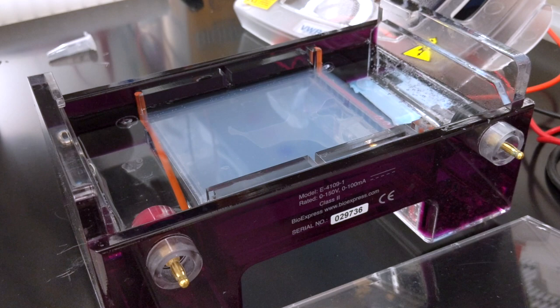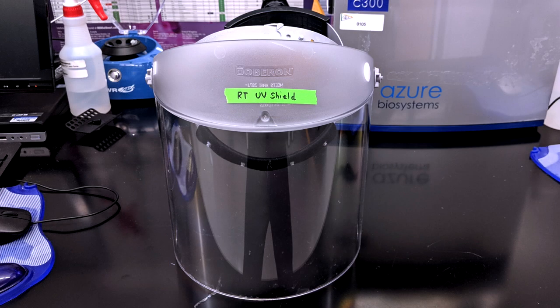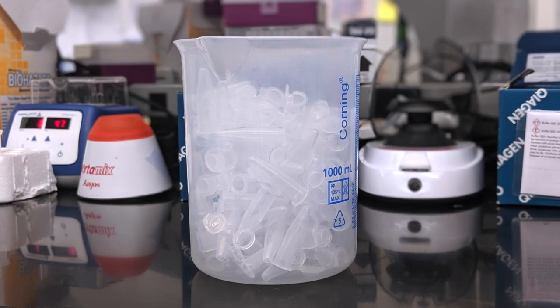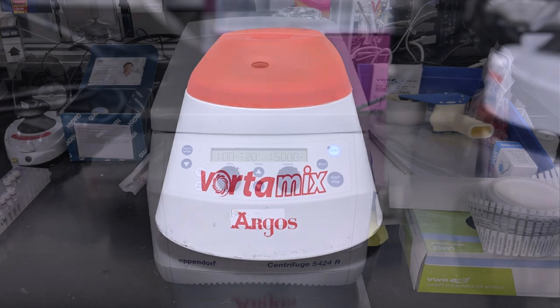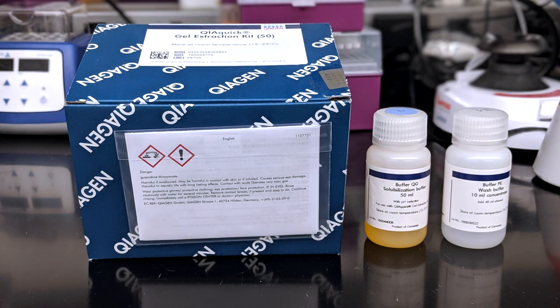For this experiment we will need: an agarose gel, a gel imager, a UV-resistant face shield, a sterile razor blade and tweezers, microcentrifuge tubes, a heat block, vortex, centrifuge, and a commercially available gel extraction kit.